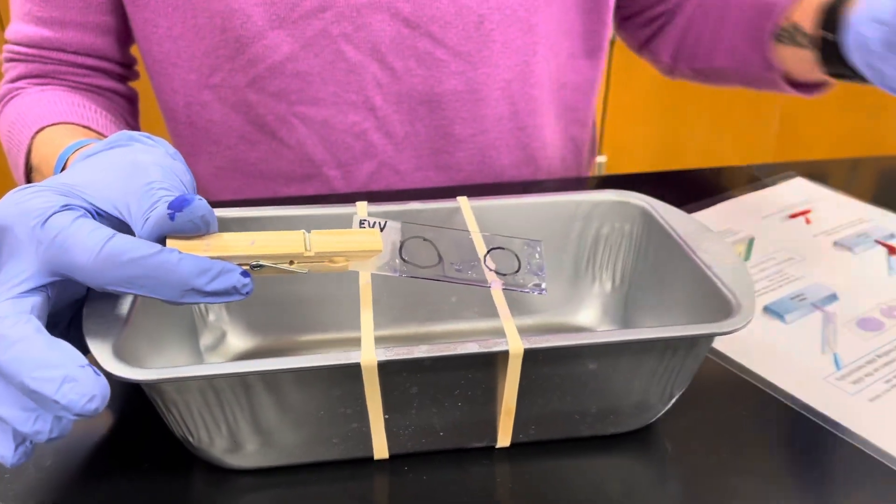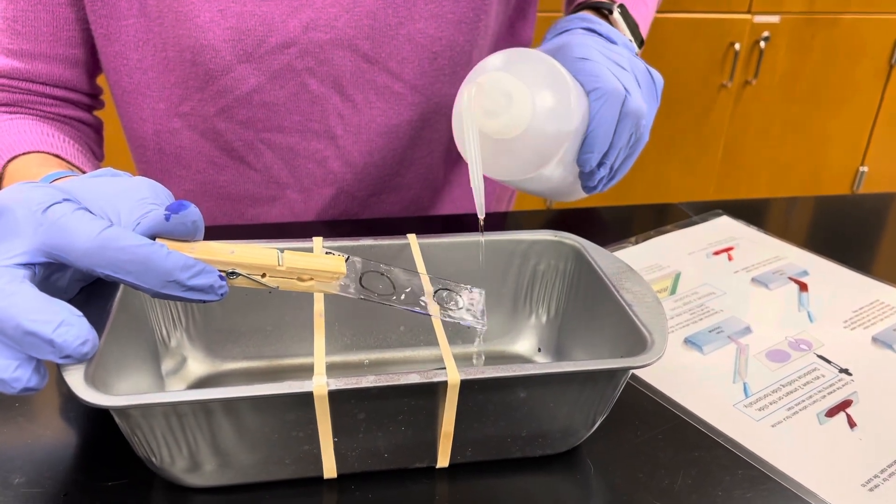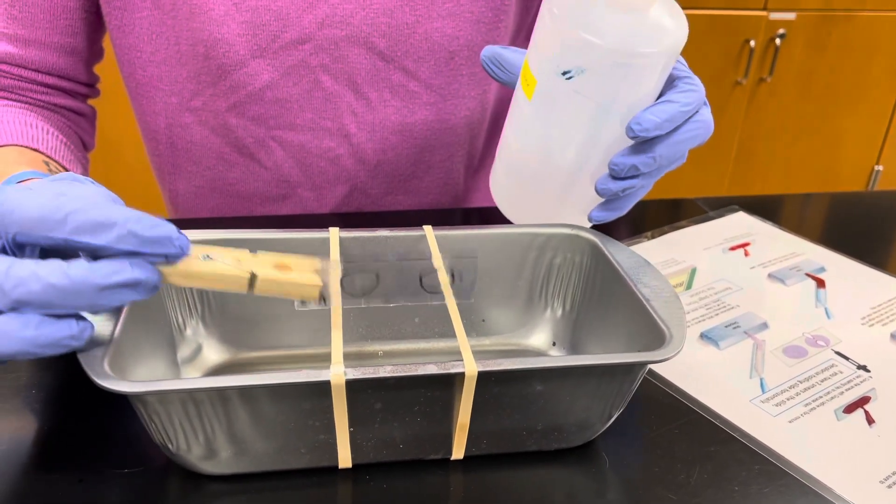Then you need to rinse off your decolorizer. Tap off the excess.